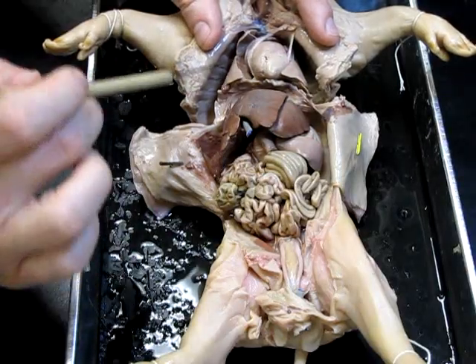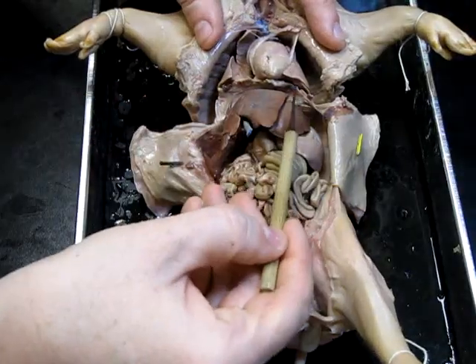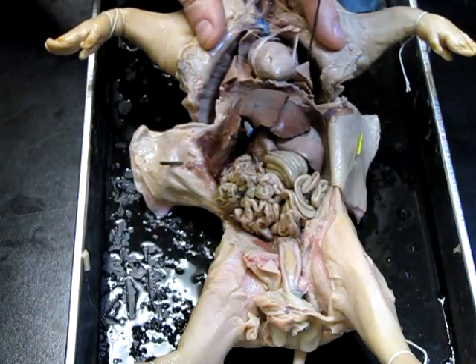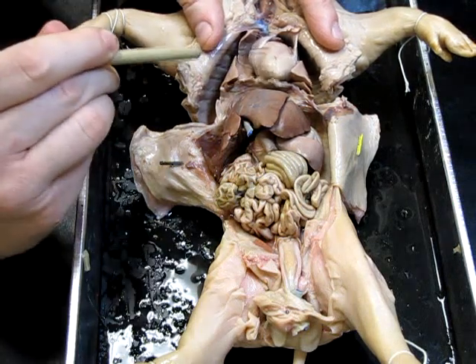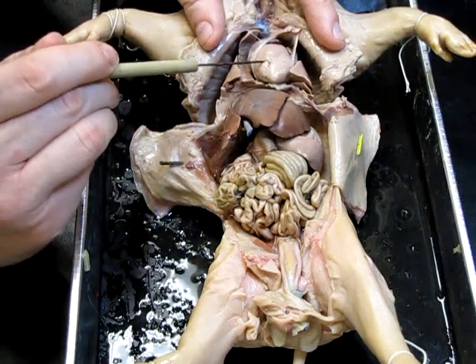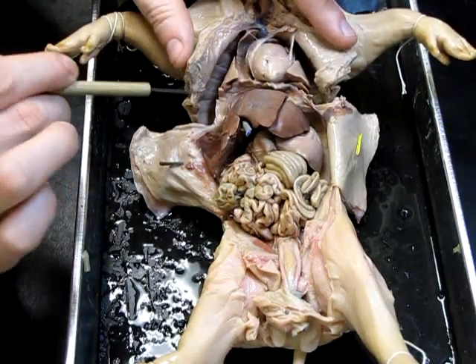Speaking of that, we do see one of the lungs on this side and the other lung on this side right here. Those are the two lungs, and in between those we find the large four-chambered heart. That's pretty much it for the thoracic cavity.